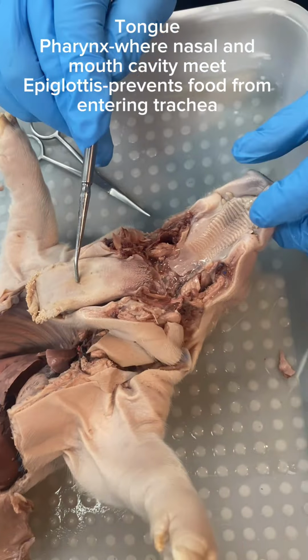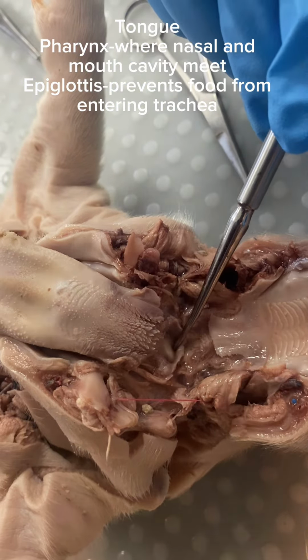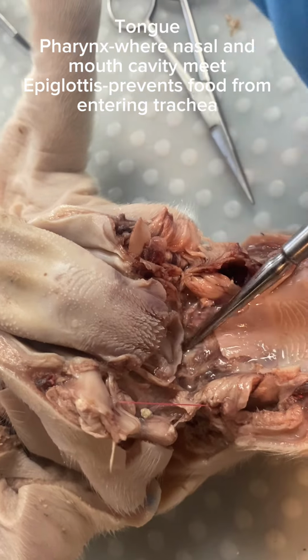This is the tongue. This whole region is the pharynx. This is the epiglottis, and then this is the esophagus.